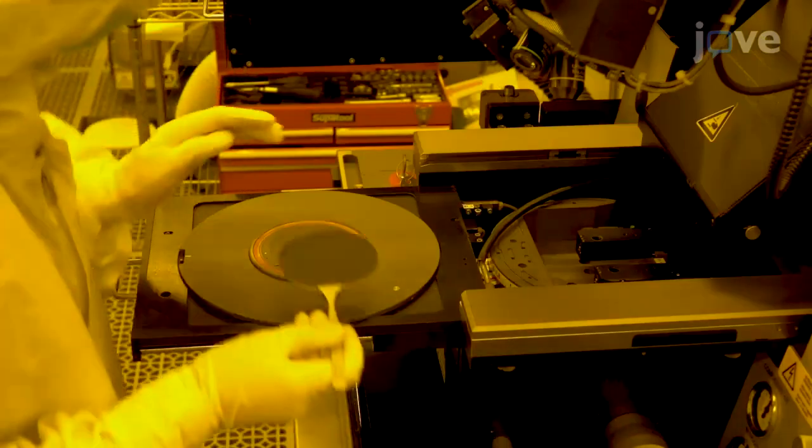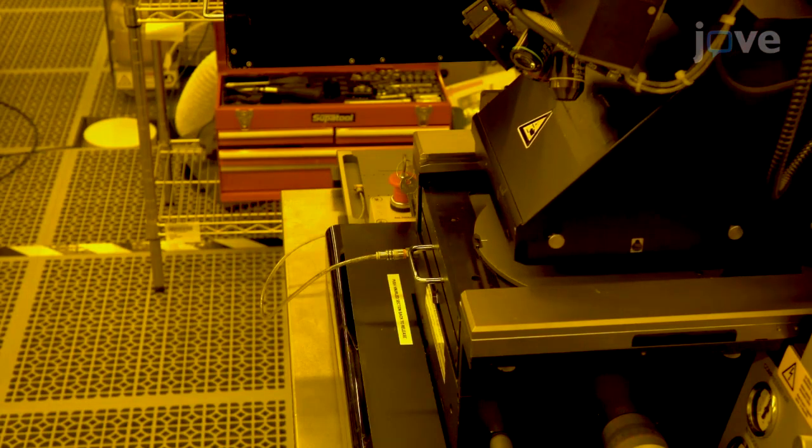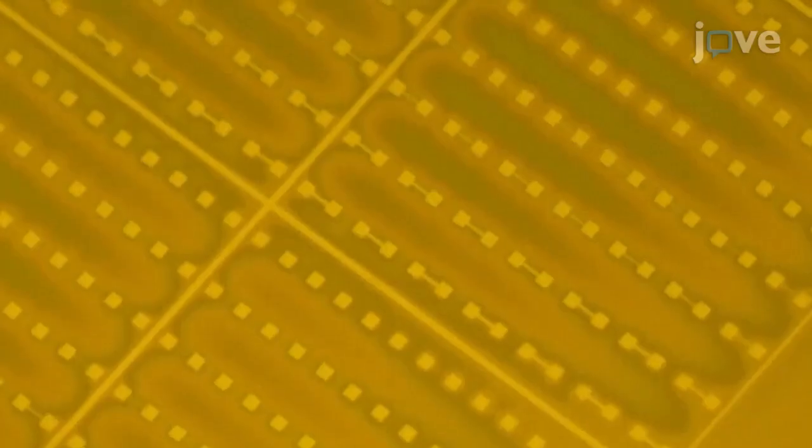Use a 400 nanometer laser to flood expose the device with 21 milliwatts per square centimeter and use developer to develop the pattern.